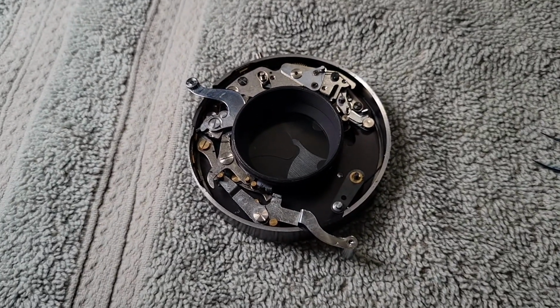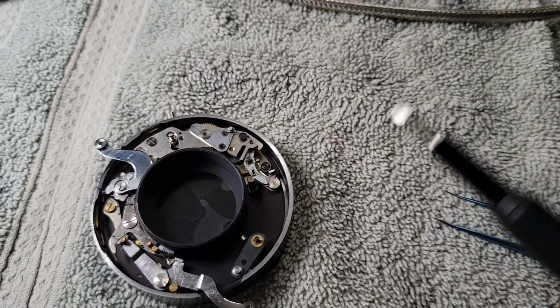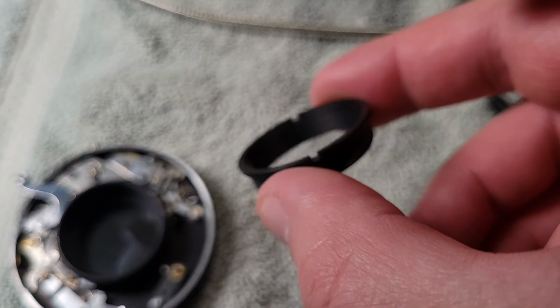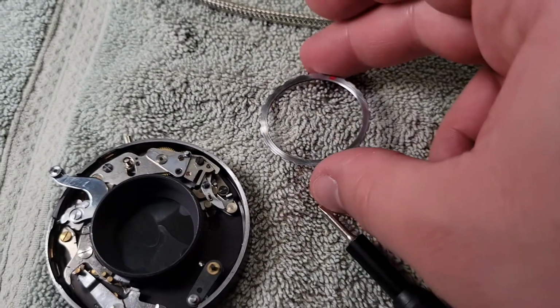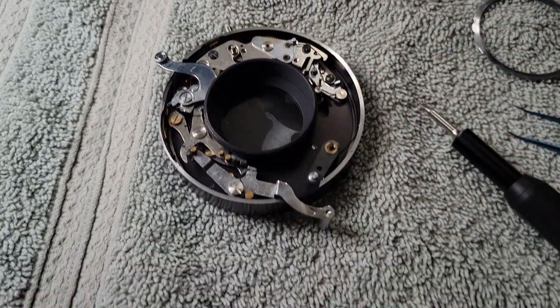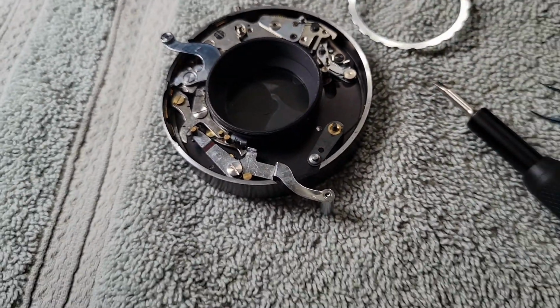But I will tell you, if you do mess with one of these, you'll want a small screwdriver like this. I think this is a 2.5 millimeter Phillips slotted screwdriver. There are multiple and varied sizes of spanner nuts. That one's about that big. There is one of these, which I've never seen. It is a kind of castle nut, I think. This actually goes on this little round part in the middle there, and holds some sort of piece on there. I don't even remember what it was. I think it's this piece. Yeah, this thing goes on there. This thing goes on that, and lines up with the red mark there, which is actually a screw. It's a whole thing.